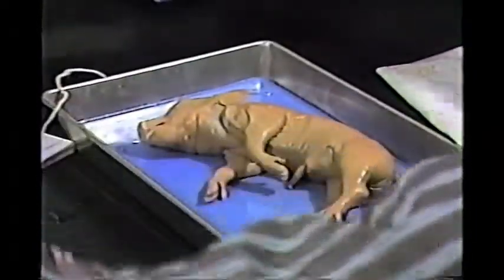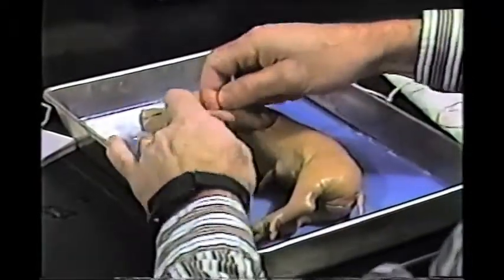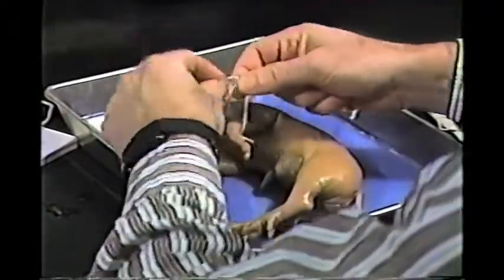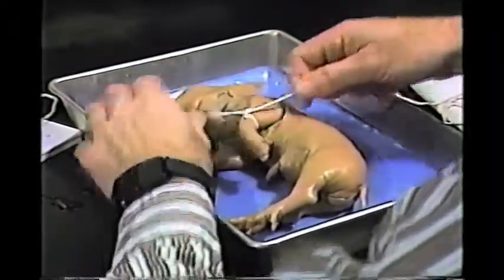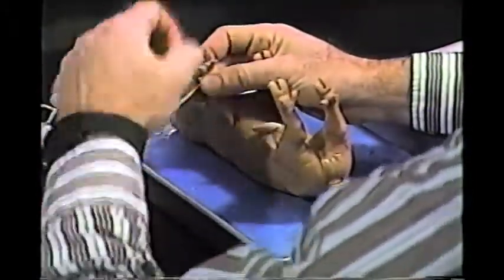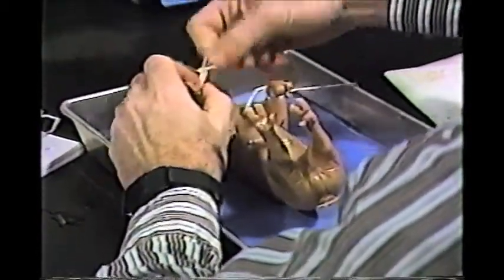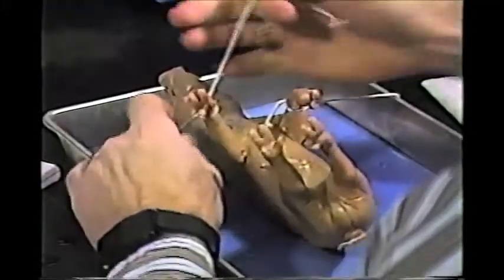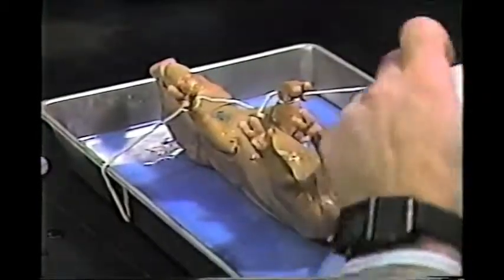Your instructor will show you where the ropes are, and we need 2 lengths of rope, and you're going to tie this around one limb and then pass this underneath the tray, and you want the animal on its dorsal side, the back side, and we're going to tie it securely, and then we're going to do the same with the hind limbs.